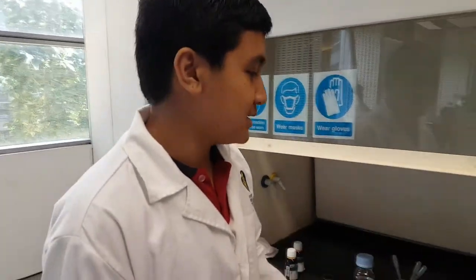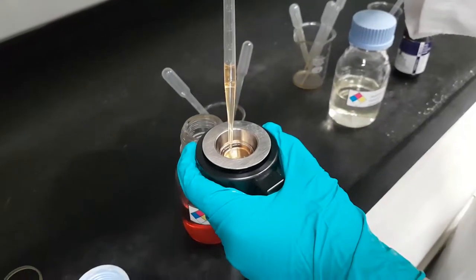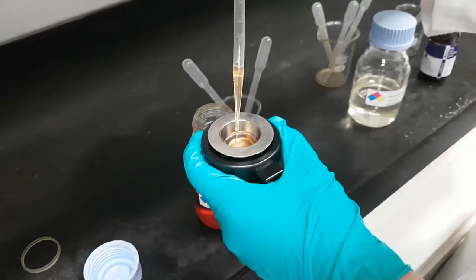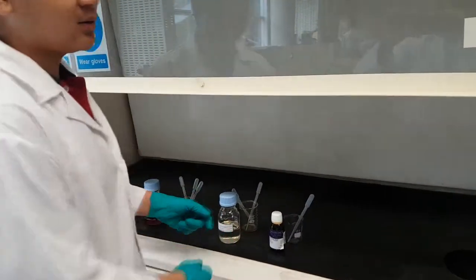We can record the data of the true flashpoint. Then we repeat the experiment by changing the sample to diesel and CRM. When taking the sample, we take it under a fume hood. This is CRM, this is kerosene, and this is diesel. When taking the sample, please make sure to wear gloves and use a dropper to take the sample.